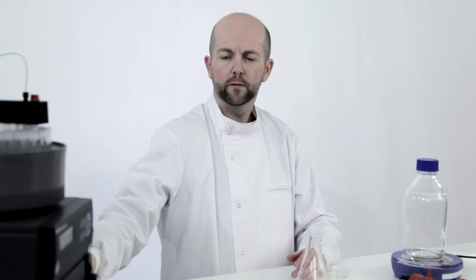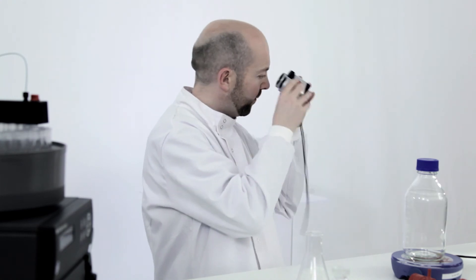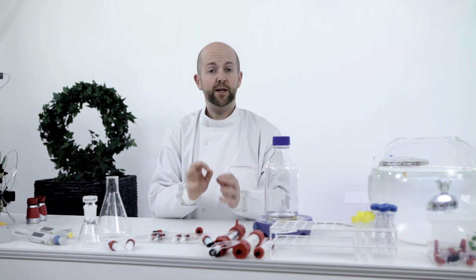Why don't you check the link to the buffers? Mike's tip number 4: remember, you have much more freedom using reducing agents than you think. You can use all the usual reducing agents. The important tip is always to do a blank run first without reducing agents. Then apply the sample to the column in binding buffer containing the reducing agent. Remember, never leave your column in buffers containing reducing agents or the protein binding capacity of the column will be lowered. Check out the link to the list of reducing agents.